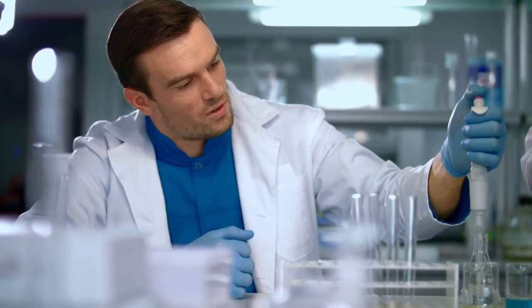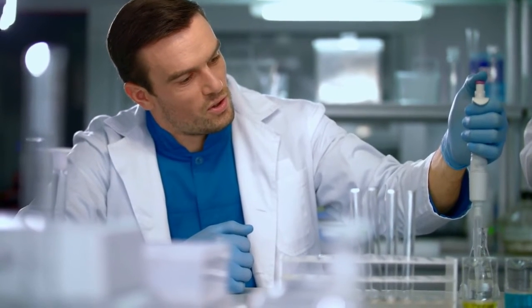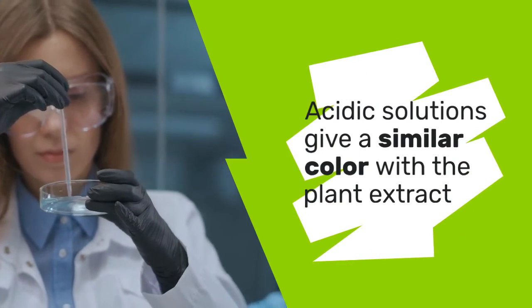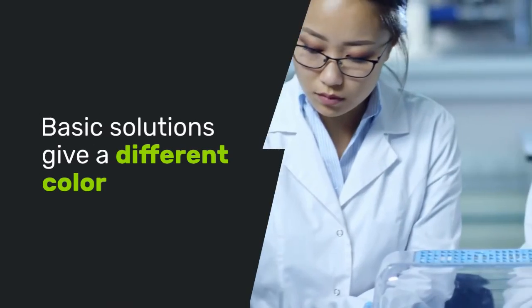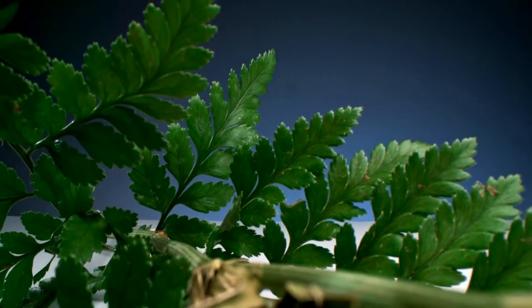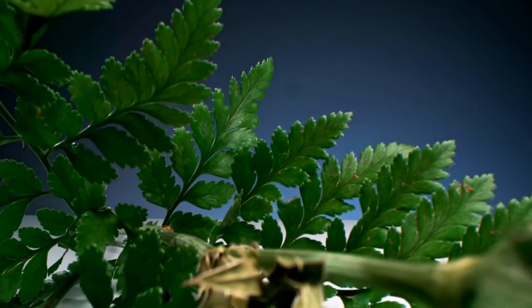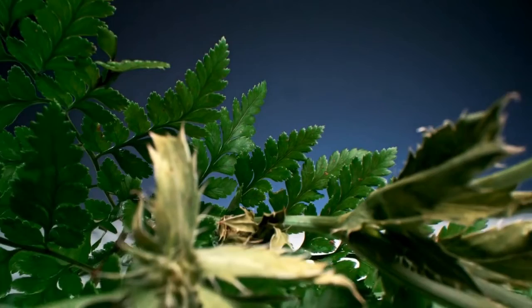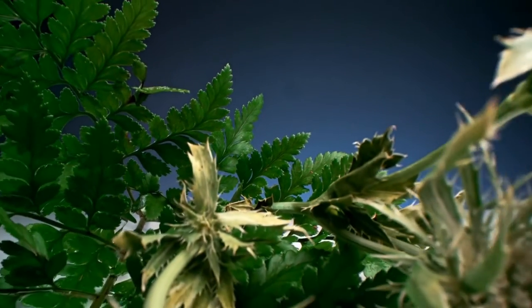In conclusion, we'll summarize the key points. Acidic solutions give a similar color with the plant extract, while basic solutions give a different color. Plus, we'll note that the plant extract indicator should only be used when fresh.